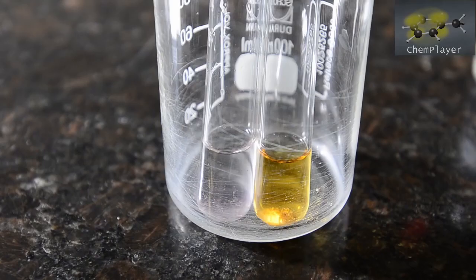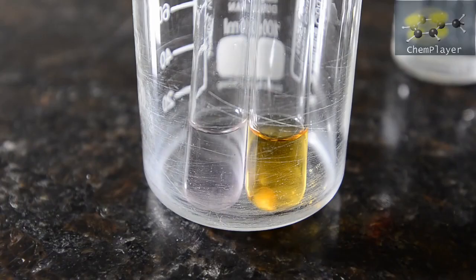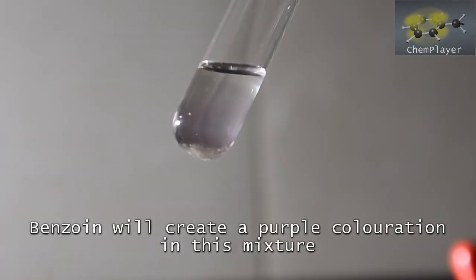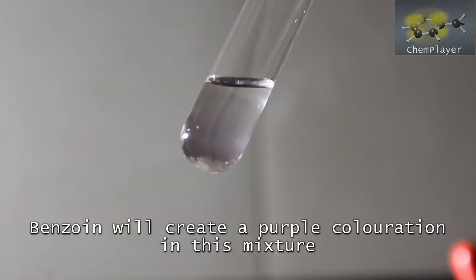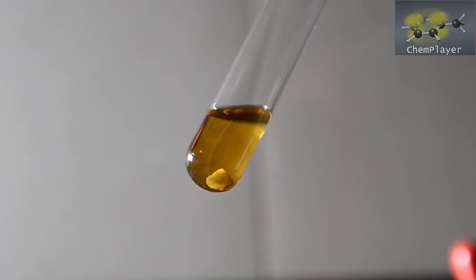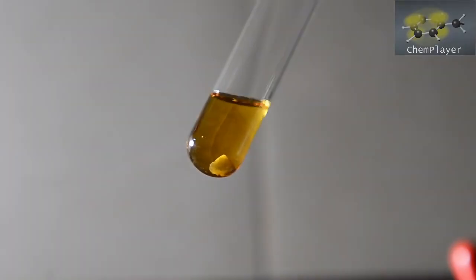On the left you can see a faint purple color starting to appear. This is the color characteristic of benzoin. On the right is our product, and the mixture has turned a yellow-orange color. We're not too sure why this is. You can see the purple color a bit more clearly held up against the light. Well, if there was a purple color in here we probably wouldn't be able to see it.